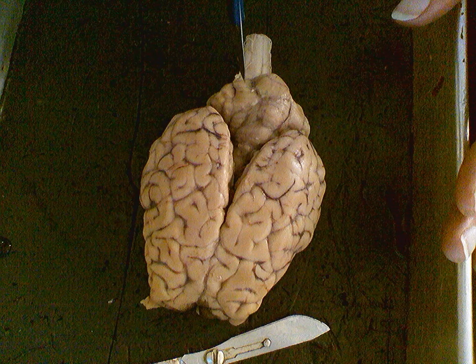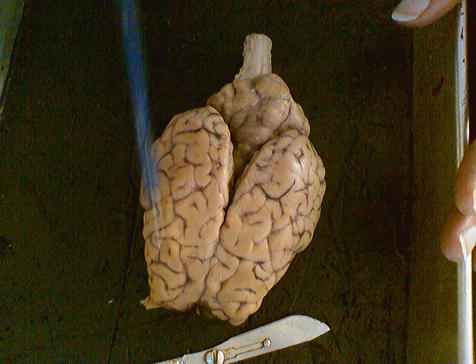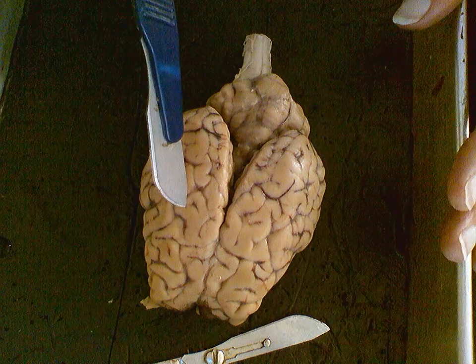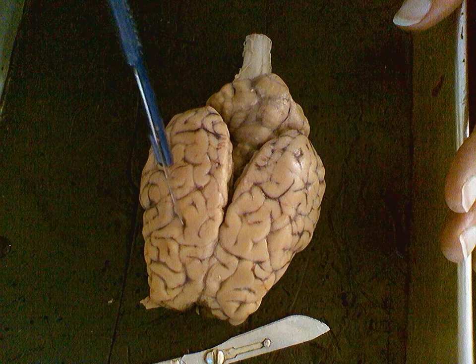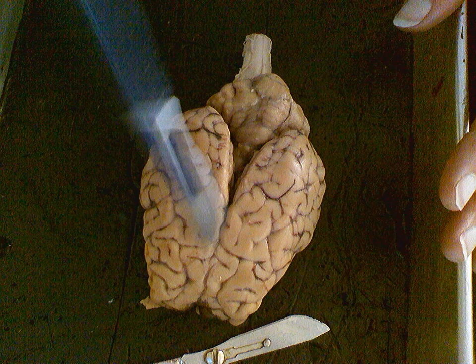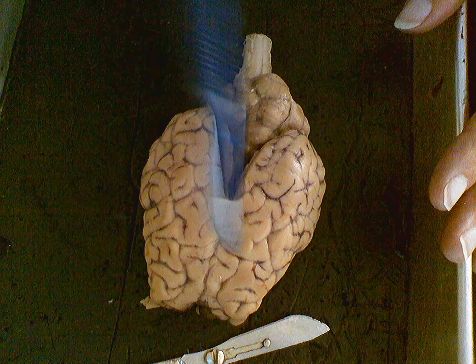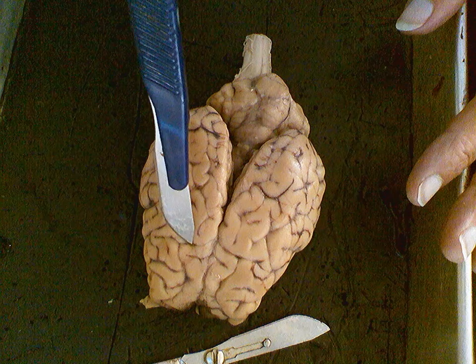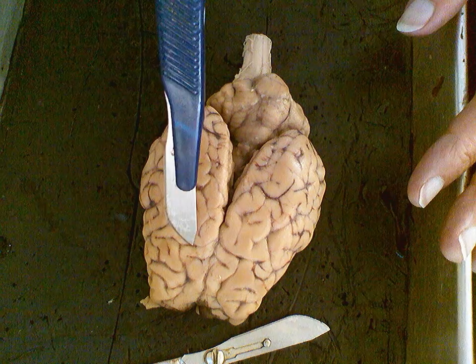Now, to the major regions that we're looking at here, we have this whole area on both sides where we see all these areas that are raised, the gyri, and we see areas which are indented or sort of depressed, and those are the sulci. We see some of these are more obvious than others. This one right here on a sheep brain is a little harder to see than in the human brain. So this right here, on both sides, we would say is more or less analogous to our central sulcus. So that's an example of one of the sulci, or an individual sulcus, so that's plural, sulci. Singular is sulcus.